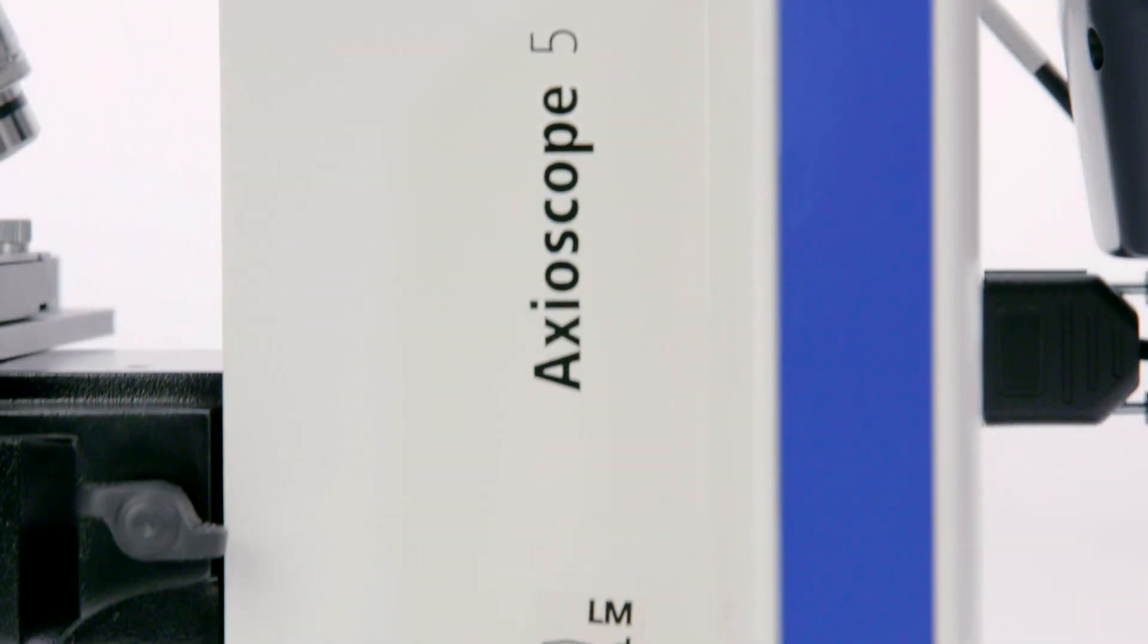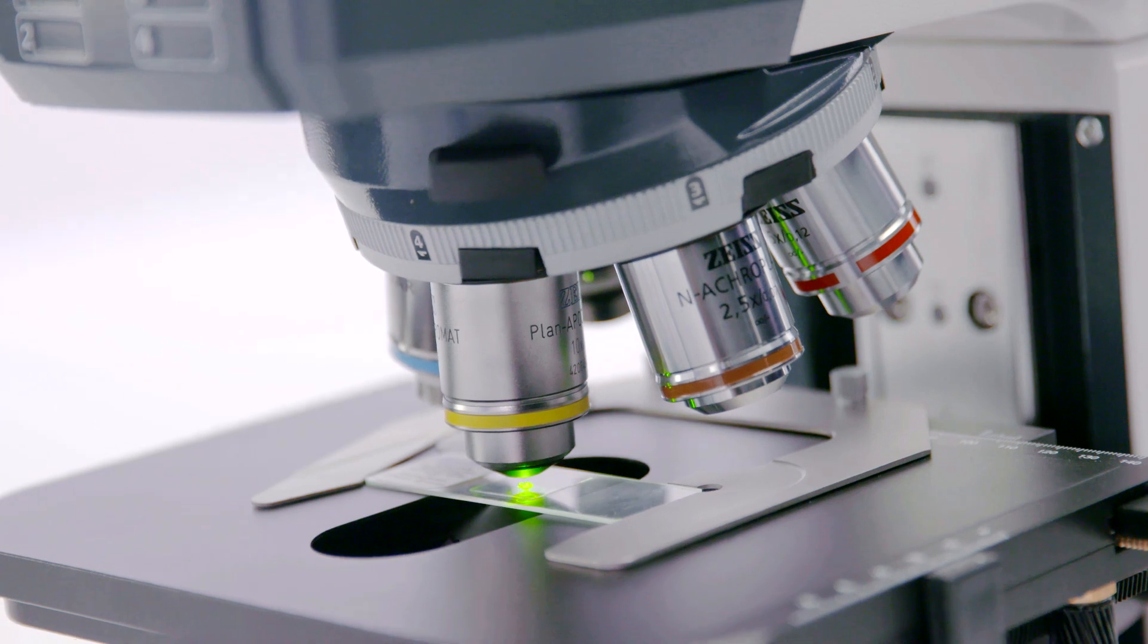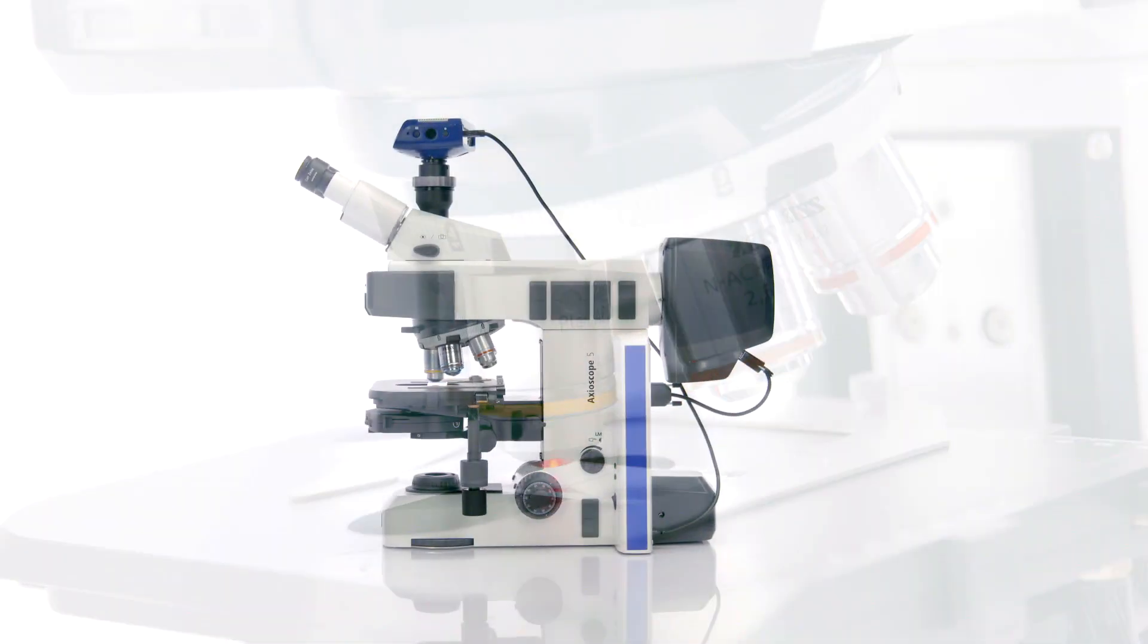With smart microscopy and Axioscope 5 from Zeiss, you can do it all in one go. Here's how it works.